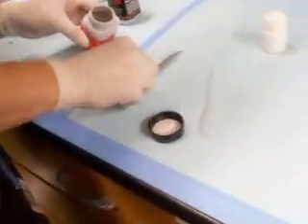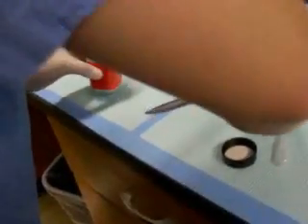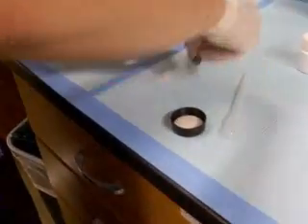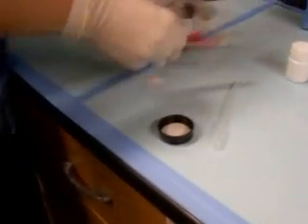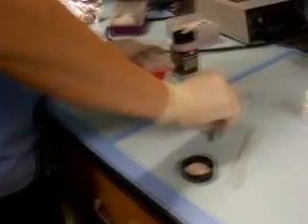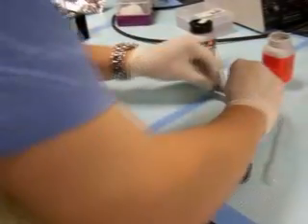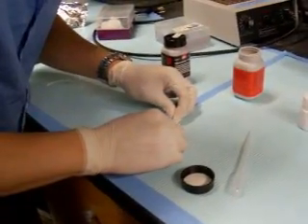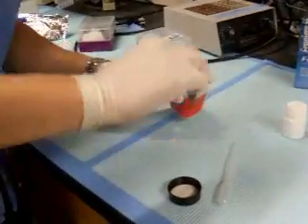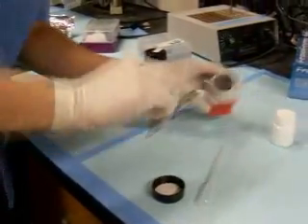The perforated nature of the wipes used for cleanup in many ways counteracts the effectiveness of this detoxification. But we must soldier on. At this point, it appears that 99.76% of the mercury has been removed. The remaining fraction left over should be disposed of in these final scoops.